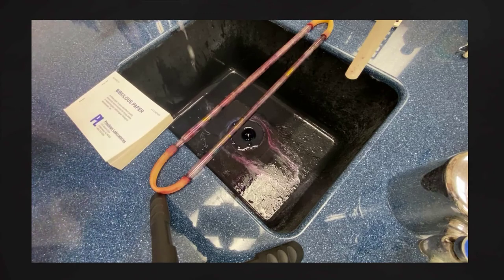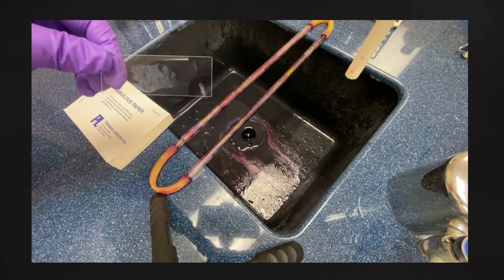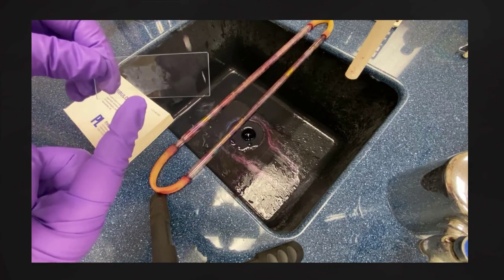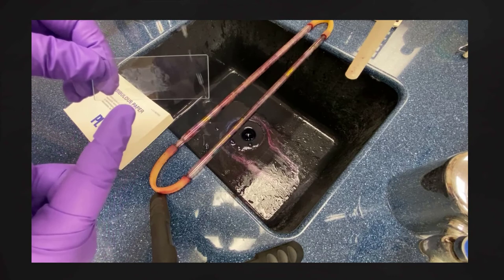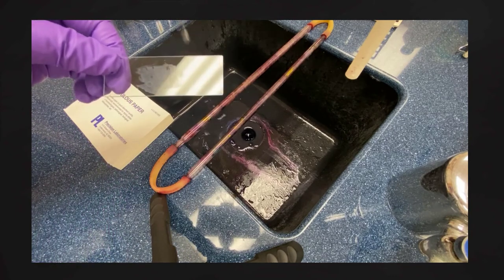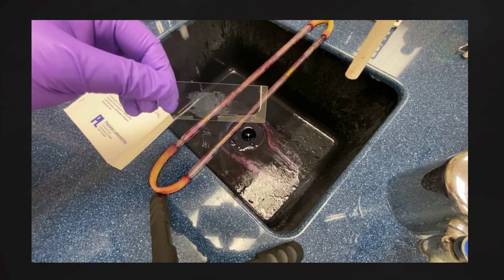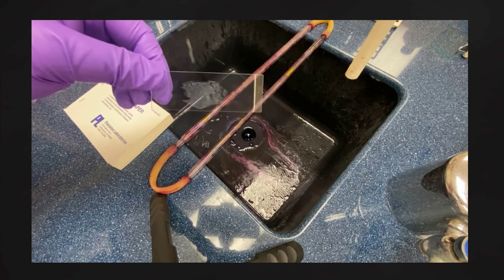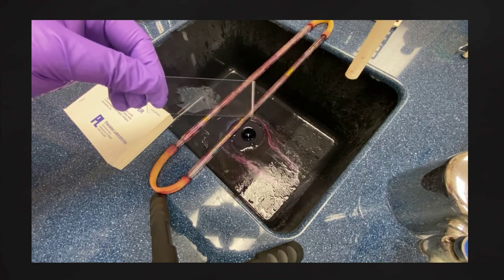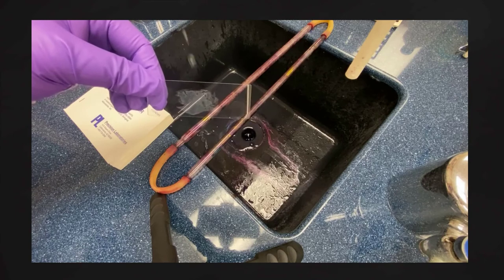Once the slide is dry, you'll notice the smear has a coloration — in this case a very pale blue — and that's why the cells appear blue underneath the microscope. If you have any questions about the simple staining process, please let me know.